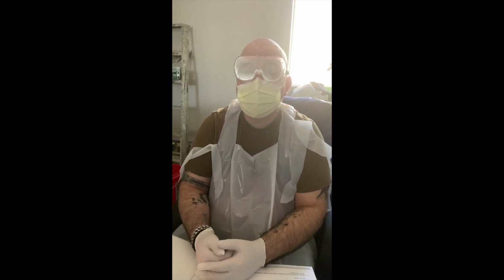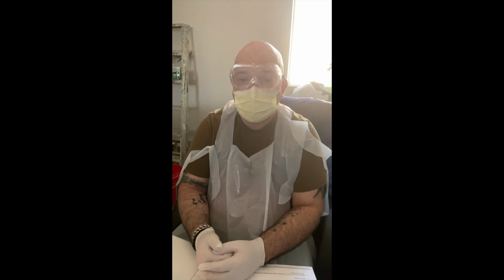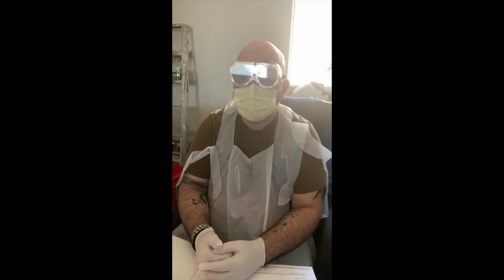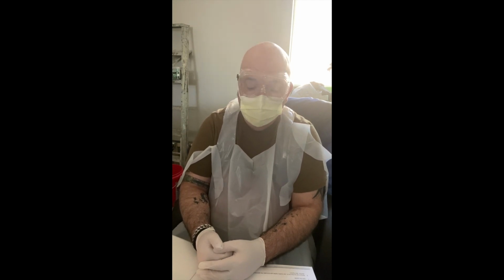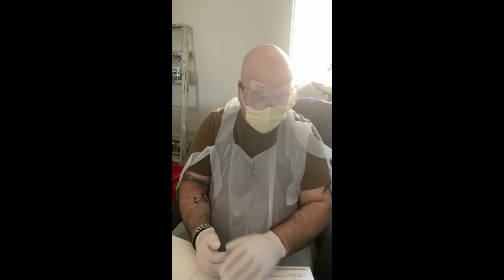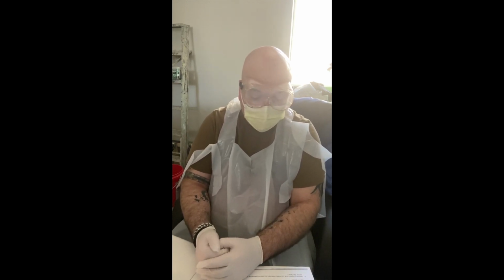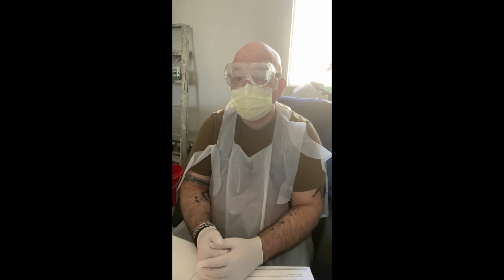My name is Ricardo Sandoval, and this video is for week 4 of Biology 225, Microbiology at Los Angeles Pacific University for the summer 1 term. This lab again is lab 7. This is called Bacteria Identification through Functional Media Motility Testing.